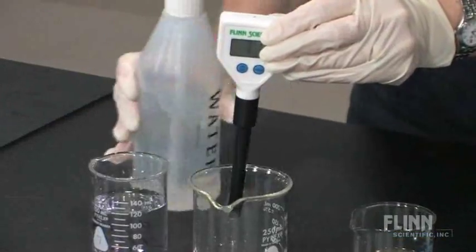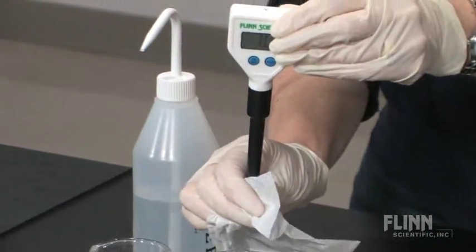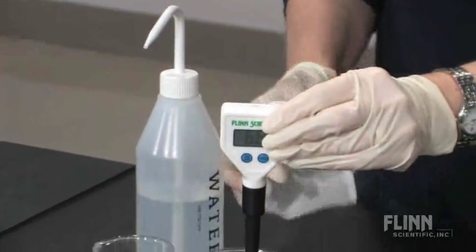The electrode should be rinsed with distilled or deionized water between each sample measurement and blotted dry. Be careful that you do not touch the end of the electrode.